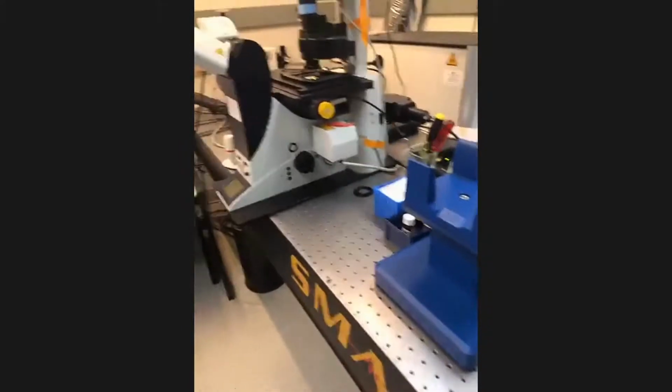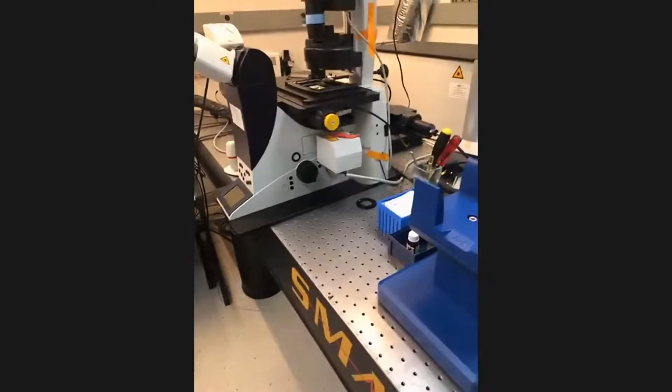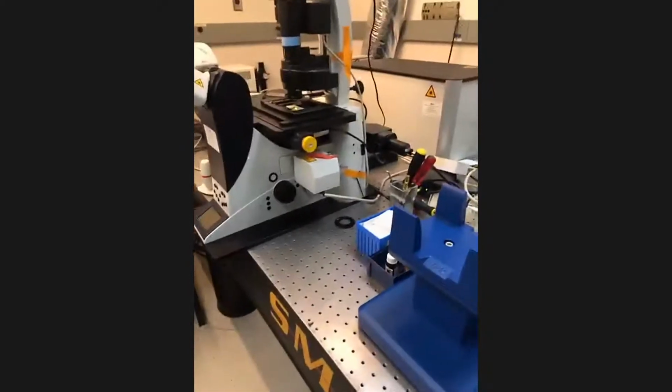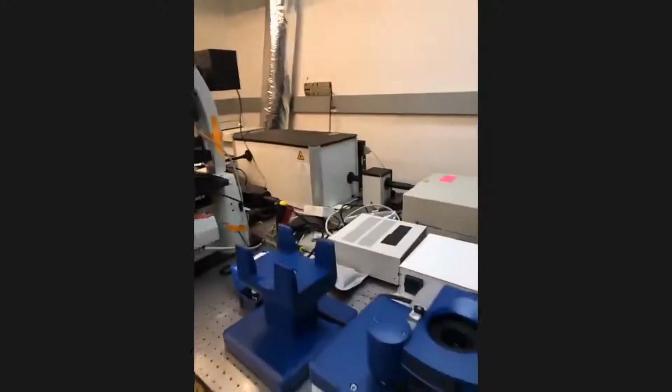I also mentioned before that we're in a very quiet environment. This is actually what's called a vibration isolation table. It's actually floating. What you're hearing right there is me touching it, pushing it up and down, and it's absorbing vibration, because anyone who's taken a picture of something that's moving knows that vibration or shaking is a problem.